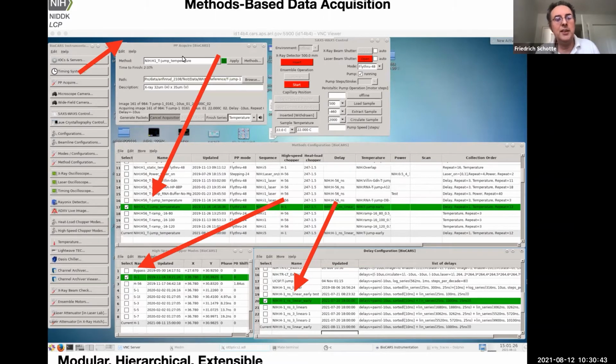And the way it's done is, here is a menu in data acquisition that has a list of modes that correspond to entries in this table. For example, we want to collect a temperature jump time series data set. It is about protein folding kinetics. You want to heat your protein with an infrared laser pulse and see how the structure rearranges itself. So in order to do that, you have to put the high-speed chopper in this mode here called H1, which selects a singlet hybrid.